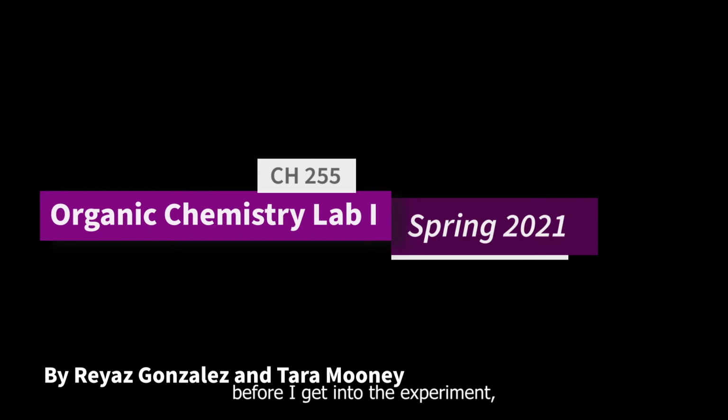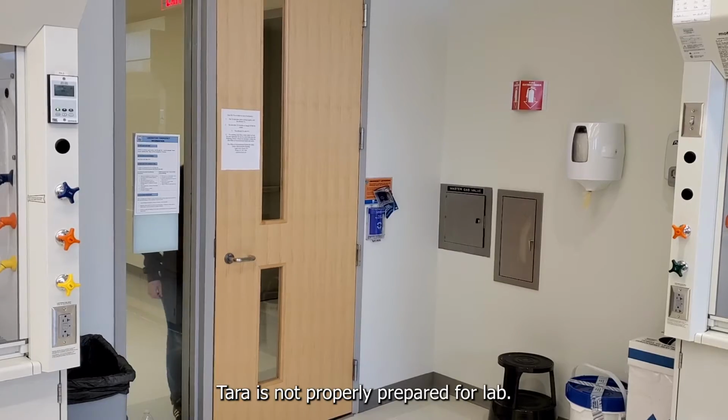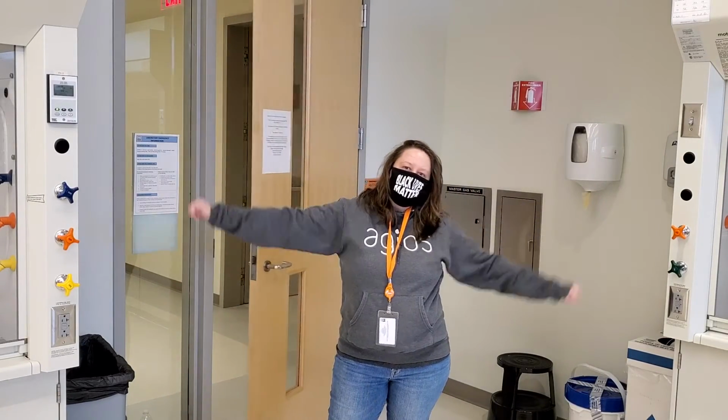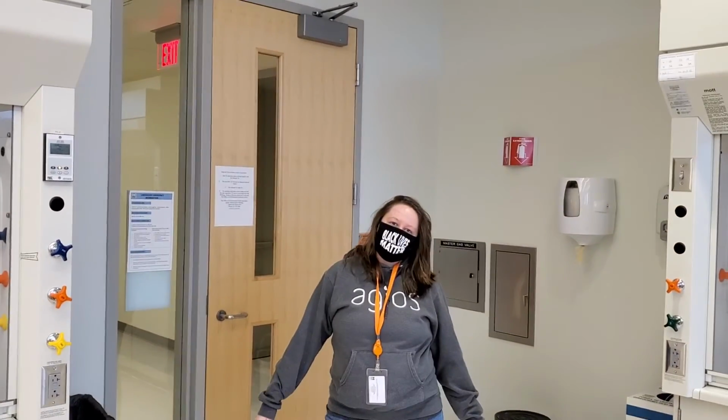As with all our videos, before I get into the experiment, I'd like to start with some general safety. Hopefully by now, you can tell Tara is not properly prepared for lab. She has loose hair, baggy clothes, and no lab goggles. The one thing she does have correct is closed-toe shoes and pants.